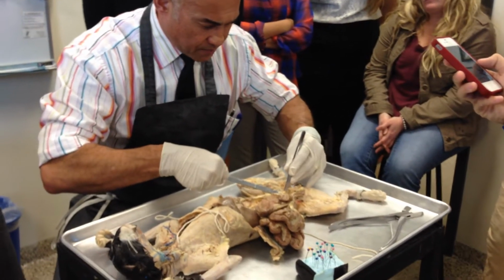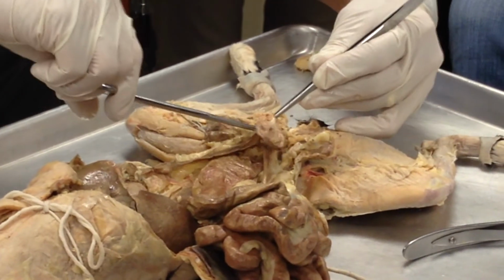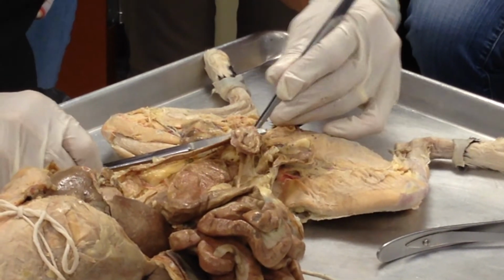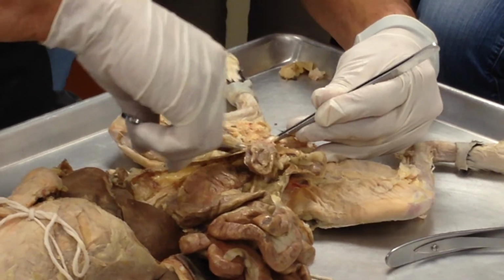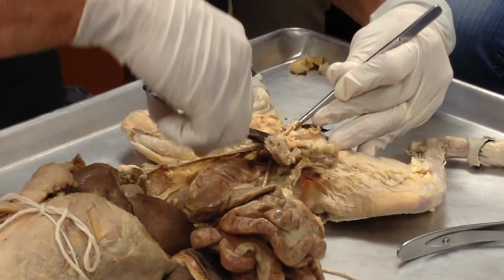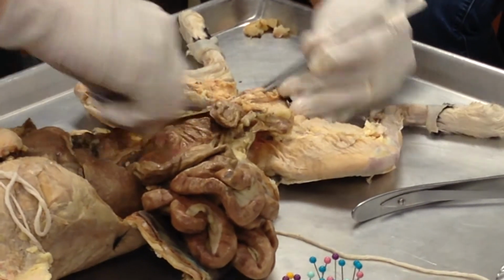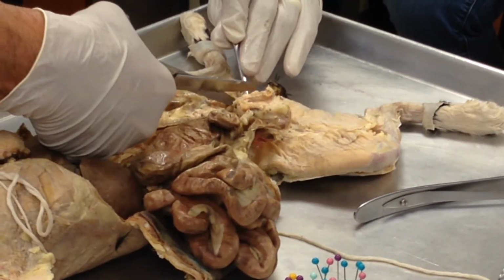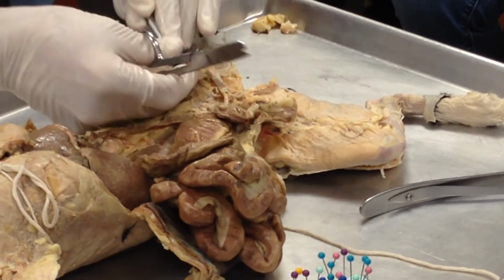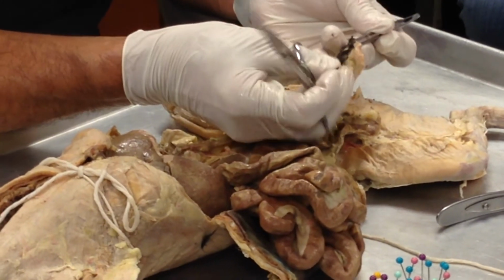Alright? So there is the urinary bladder and the urethra right there, folks. And there is the body of the uterus right there. So I'm going to grab onto both of those. I'm just going to gently peel above the rectum and the anus. And hopefully I'm going to be able to cut right through the vaginal canal and out. Okay, there we go. So that's actually nice and easy. So there's the anus right there, and there's the vaginal opening right there.